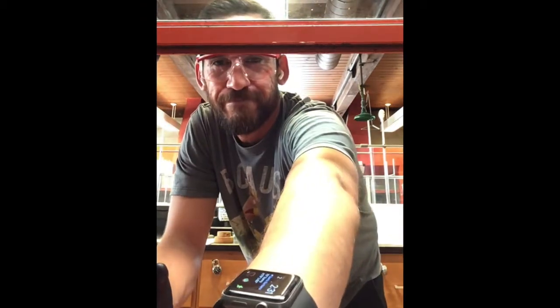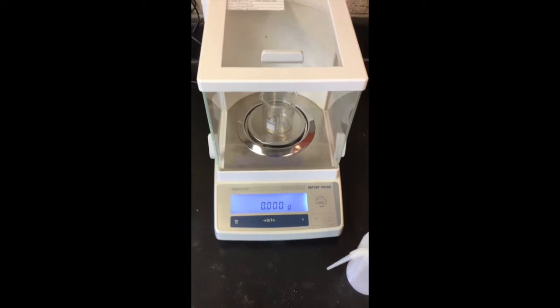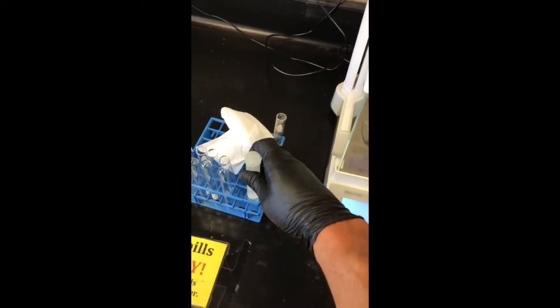Okay, so I'm too impatient. I'm not about to wait for the emulsion to go away without the centrifuge. So what we're about to do is weigh real quick how much the centrifuge tube weighs with the methylene chloride, the caffeine, and the water in there. And so what we're going to do is put a beaker on the scale, tare that, and then place the centrifuge tube inside of the beaker to see how much it weighs. Okay. All right, so we tared that. Now we get this guy. See how much it weighs.